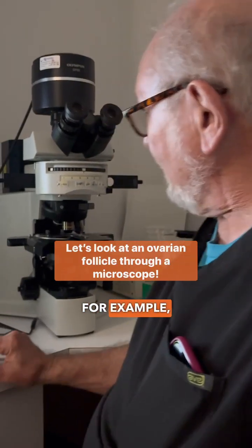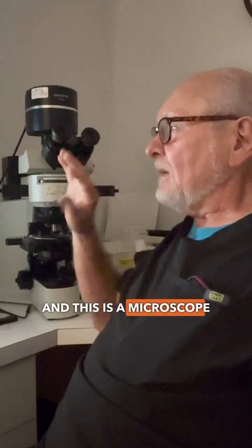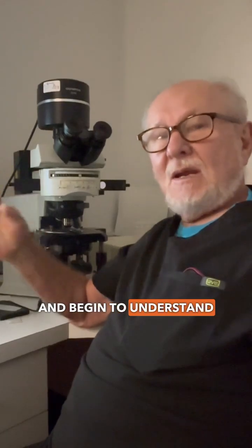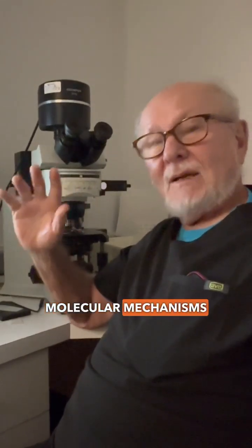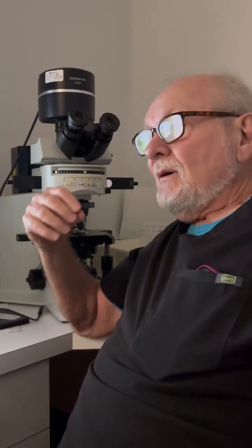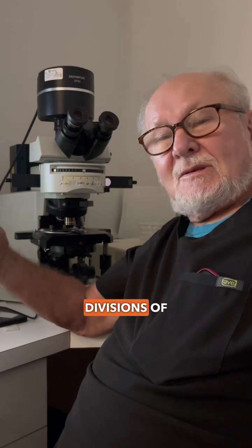Here, for example, is one of our research microscopes. This is a microscope that's essentially set up so that we can look inside egg cells, we can look inside sperm cells, we can look inside embryos, and begin to understand what the underlying cellular and molecular mechanisms are that are involved in fertilization or early cell divisions of the embryo.